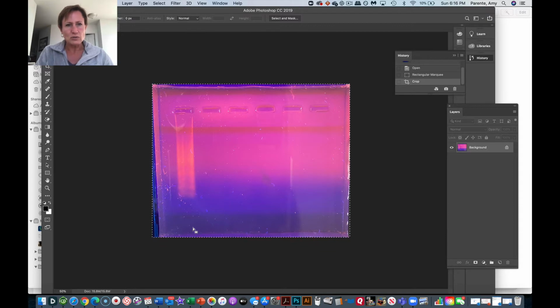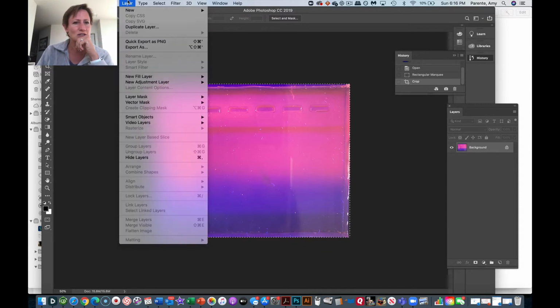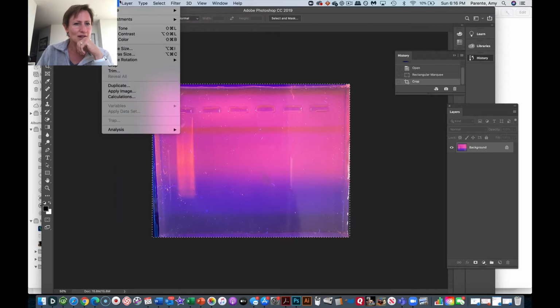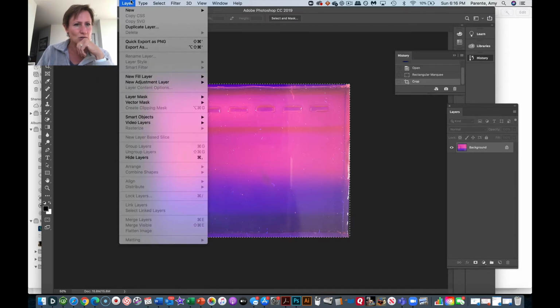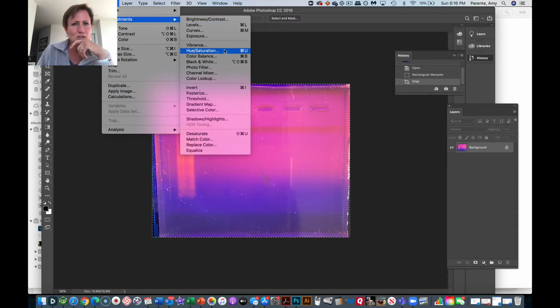So first thing that I want to do here is desaturate this. I know what these shortcuts are, but I want to show you guys where they are. So let's see, image. Here we go. First thing I'm going to do is have it auto fix the levels. So I'm going to go here and do this. This is a Command L. And then I'm going to desaturate it, and then I'm going to invert it.